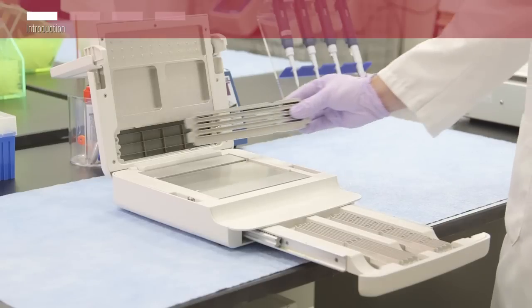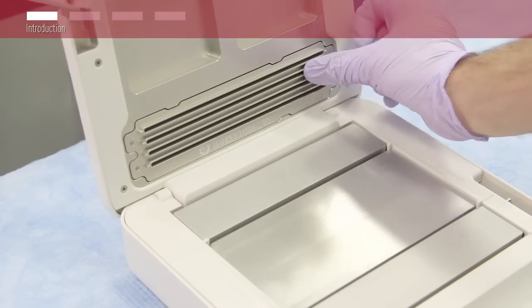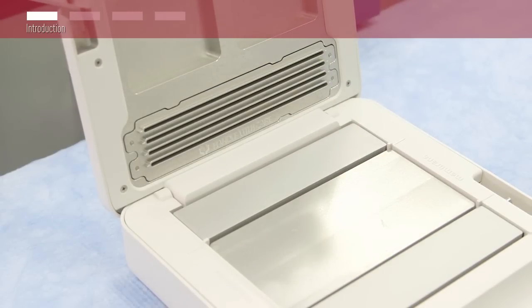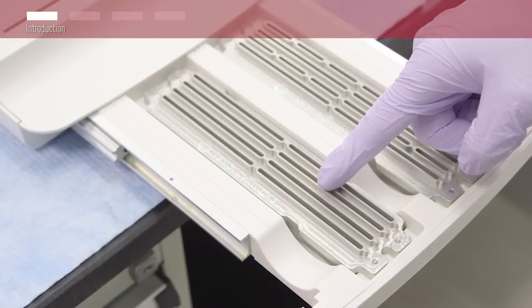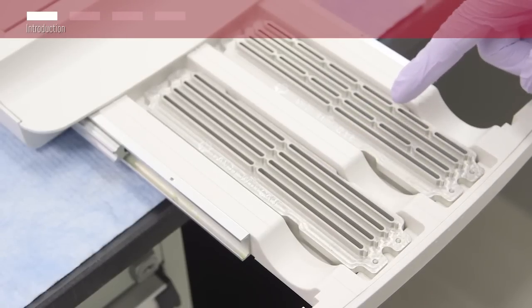With its interchangeable reagent wells, it is capable of processing MIDI sized blots, up to two mini sized blots, or up to six vertically cut strip blots.